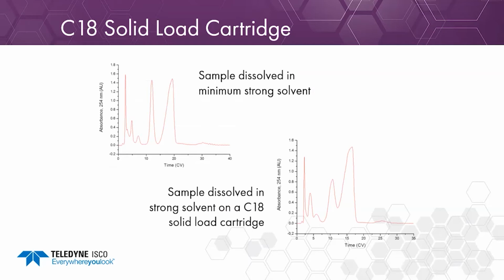It's important that when we load these onto the cartridge, we're using a minimum amount of strong solvent. And these examples are showing why. So if we dissolve the sample in a minimum amount of strong solvent, we can get good resolution between the peaks in the first top example. But as we increase the percentage of strong solvent in the dissolution solvent, you can see that we start to get coelution and we don't get baseline resolution on the C18 column there.